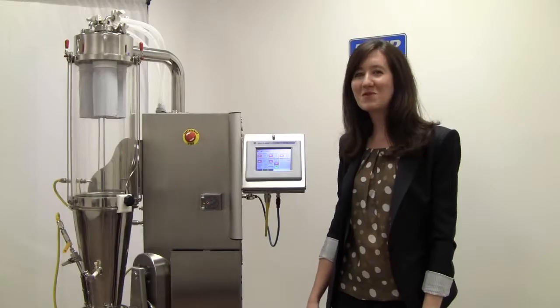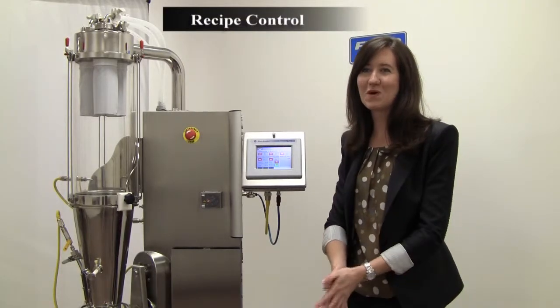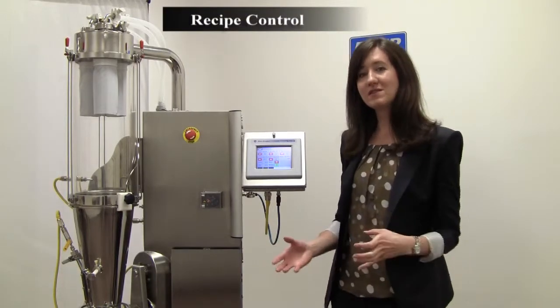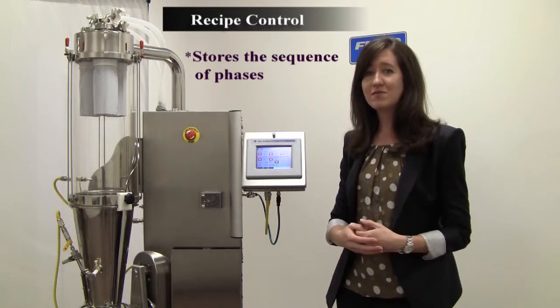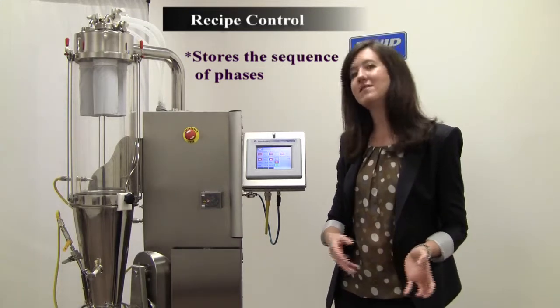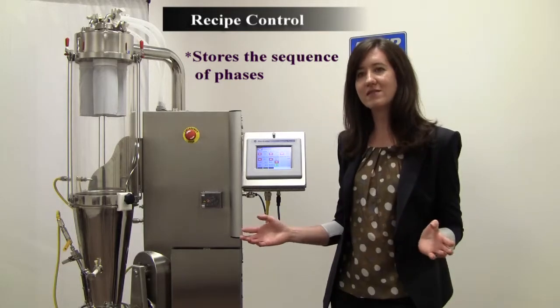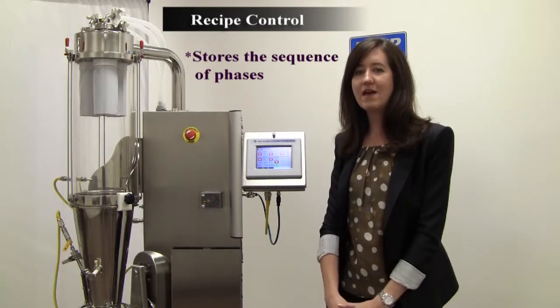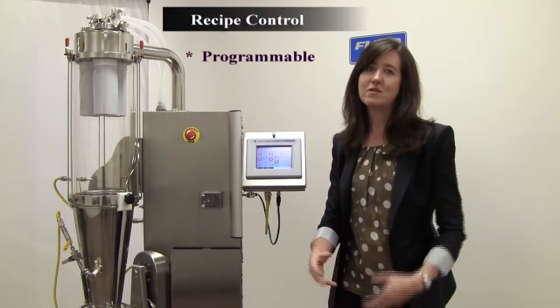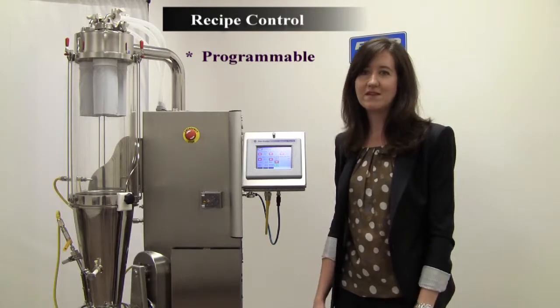Recipe control is the next level of control for the Batch Architect equipment. It actually stores the sequence of phases to be reused at a later time. These operate the same as the phase. It runs through the entire sequence and there are also end conditions that can be programmed to allow automatic transitioning between the phases.